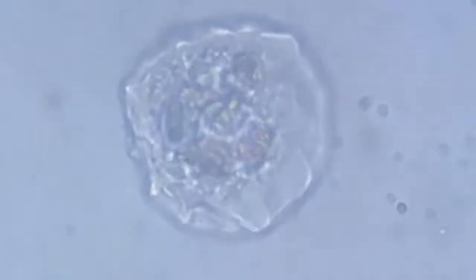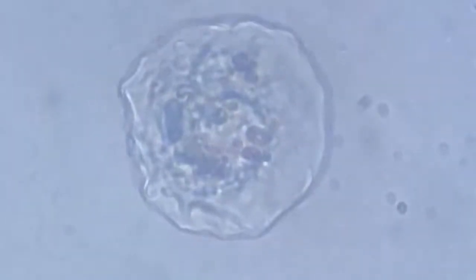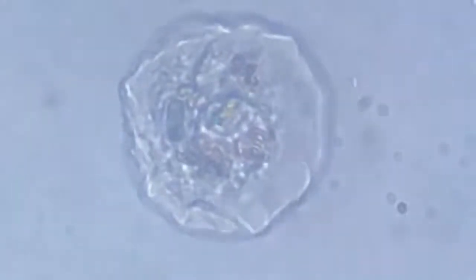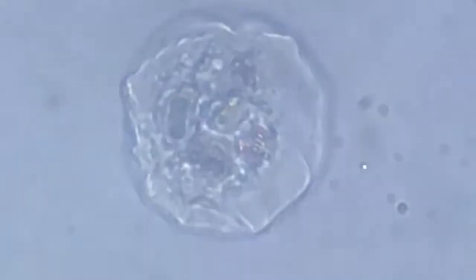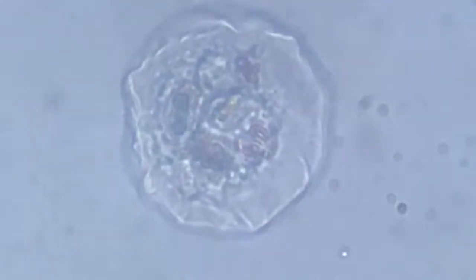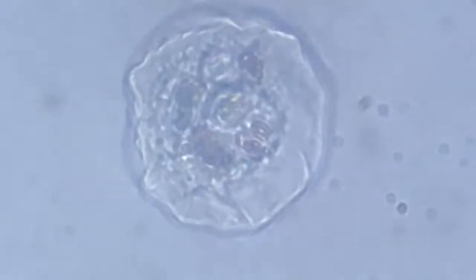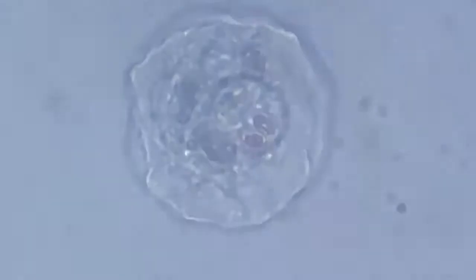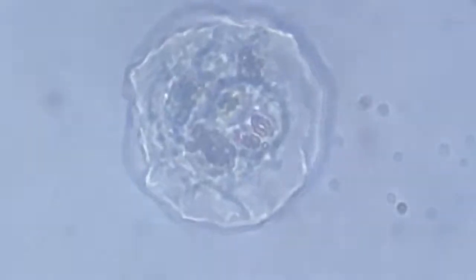This will be a very slow video, obviously, because the movements won't be sudden or continuous, but episodic. But the fun is in watching the growth of new pseudopodia, small ones like small bumps on the skin, which are then converted into a stronger force.